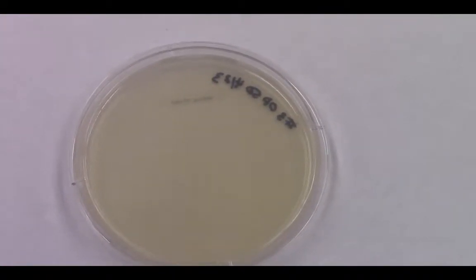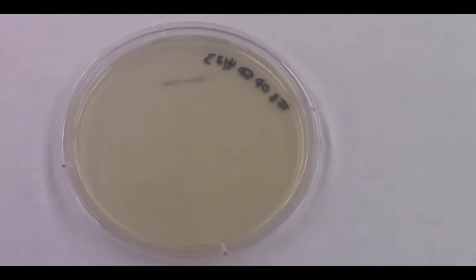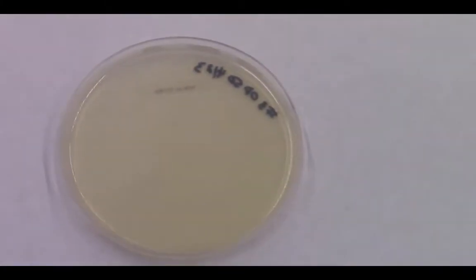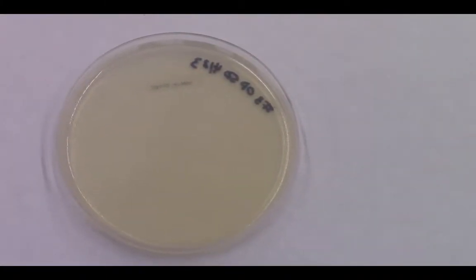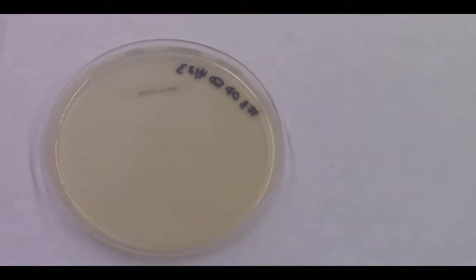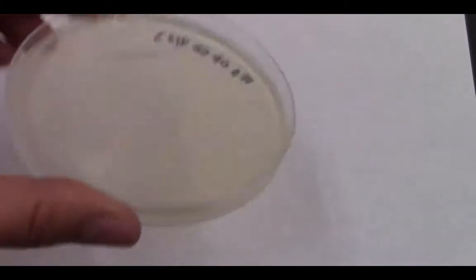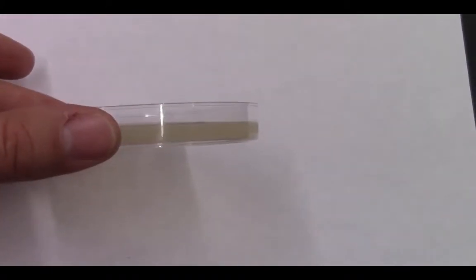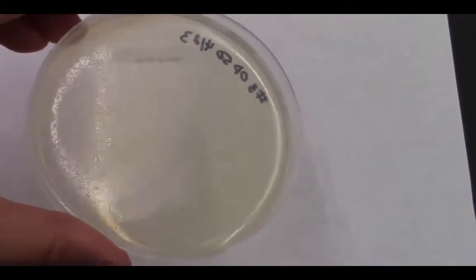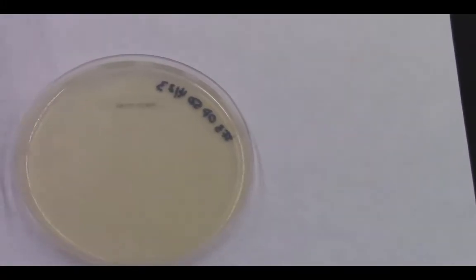In the lab you'll see these worms being cultured on petri dishes like this. These petri dishes have a layer of agar gel that's nutrient rich, and on that we grow a thin layer of bacteria. It's those bacterial cells that these tiny worms consume as they make their way through the agar, and as they consume those bacteria, they grow and eventually reach the age of sexual maturity.